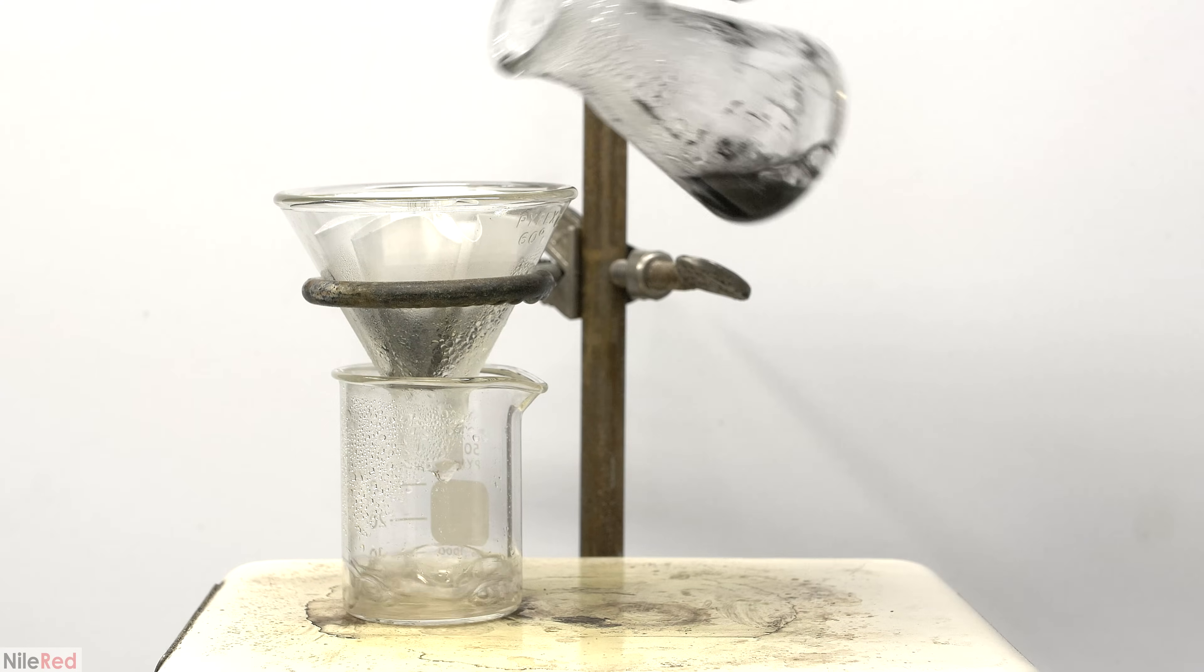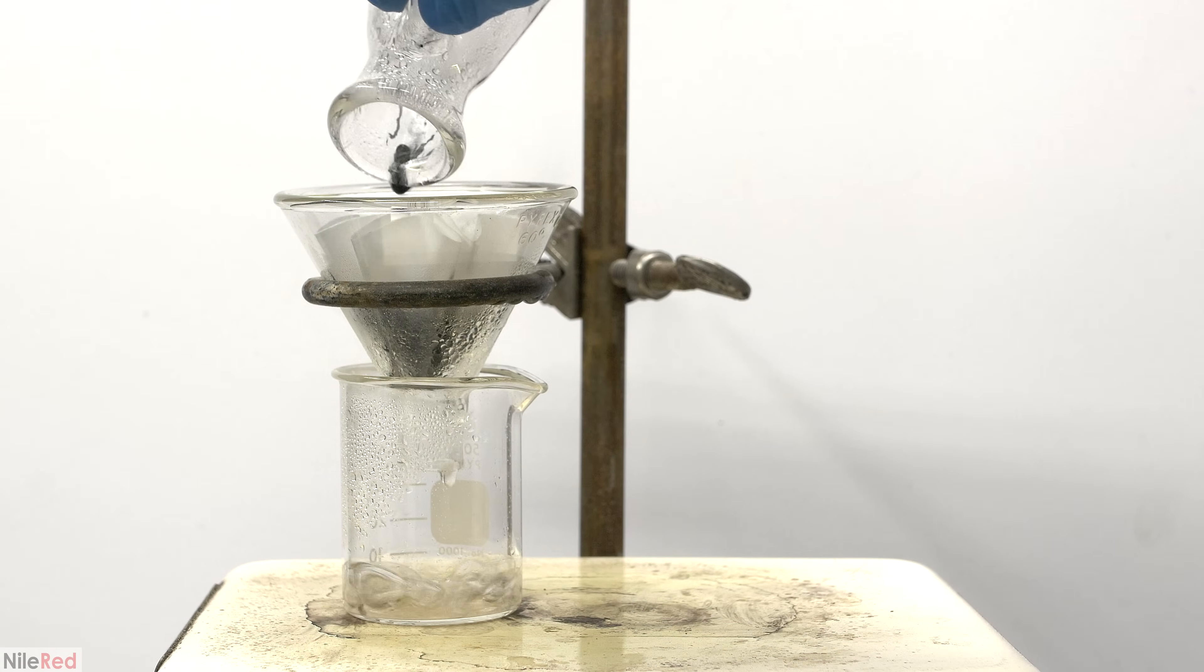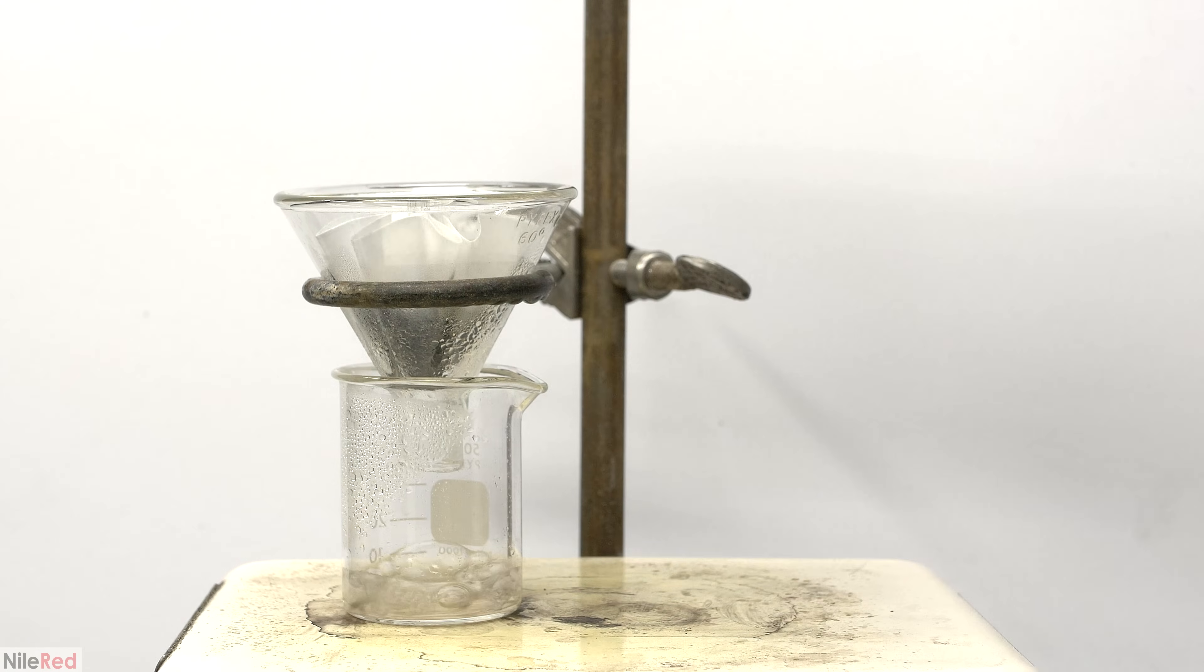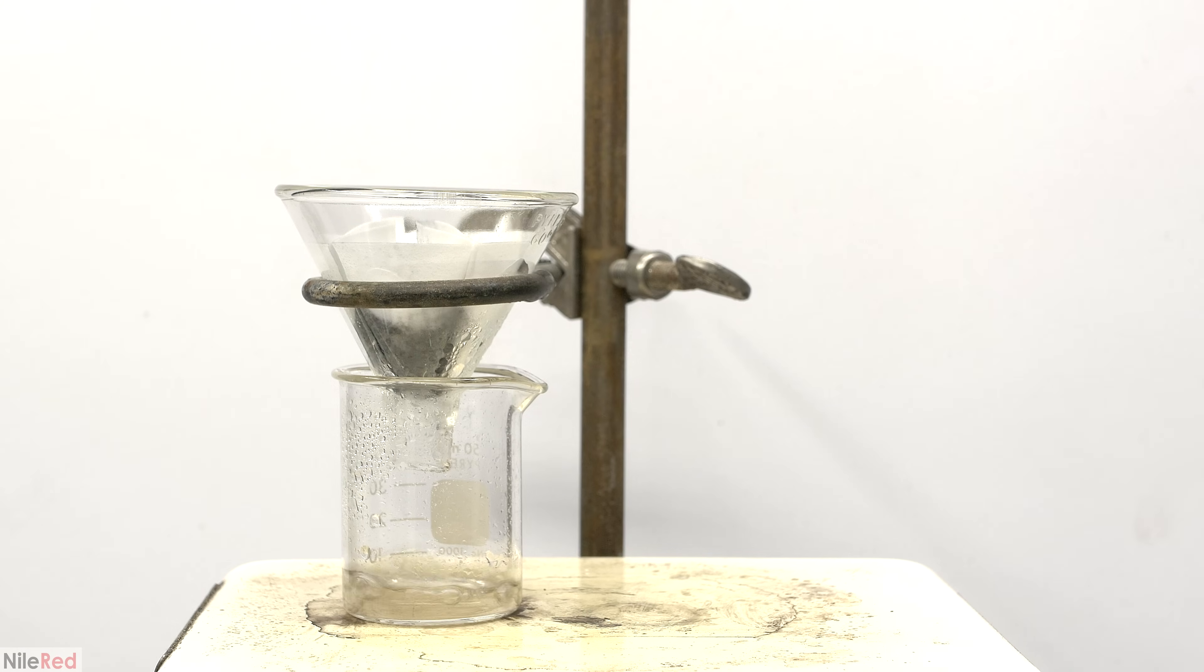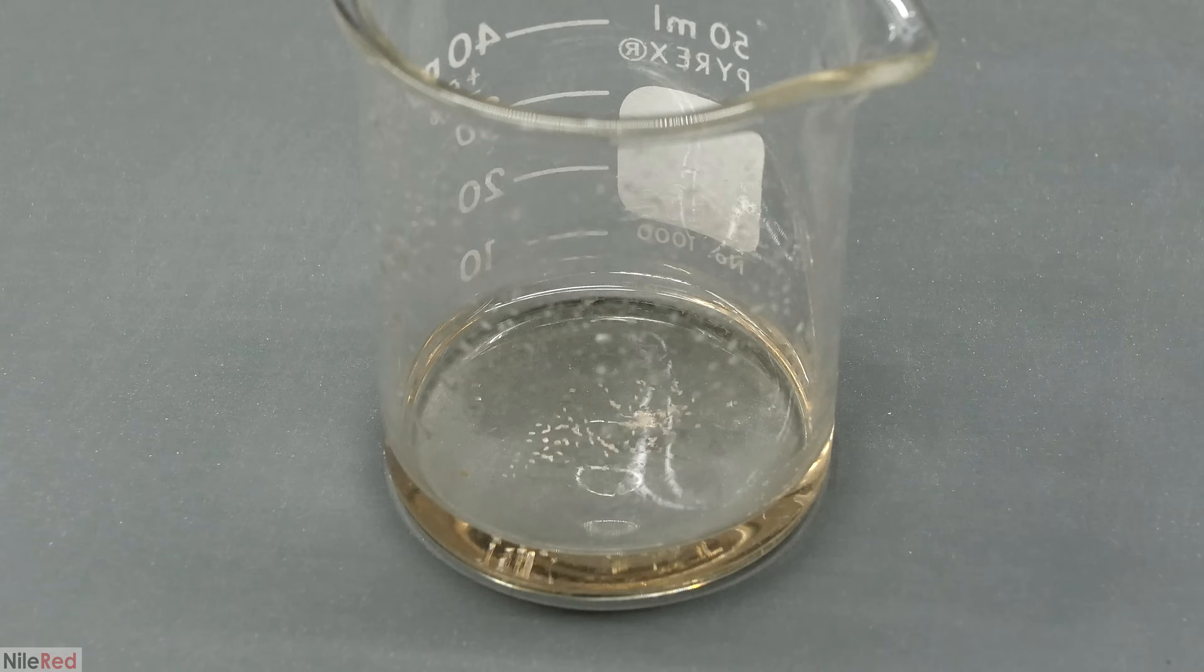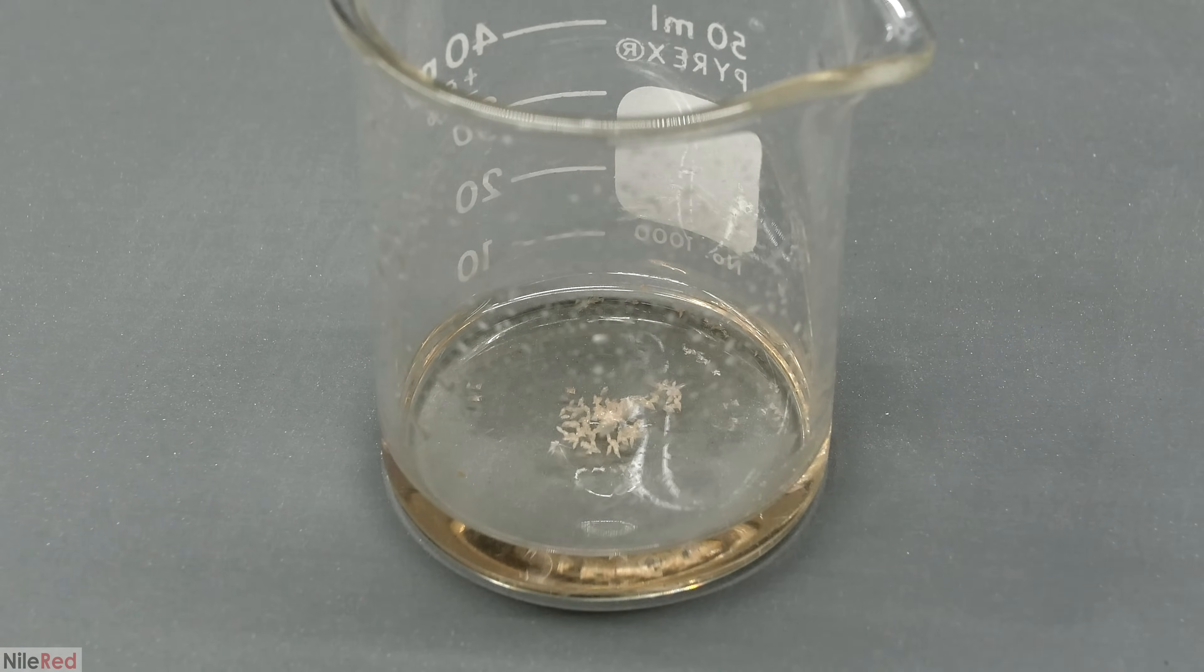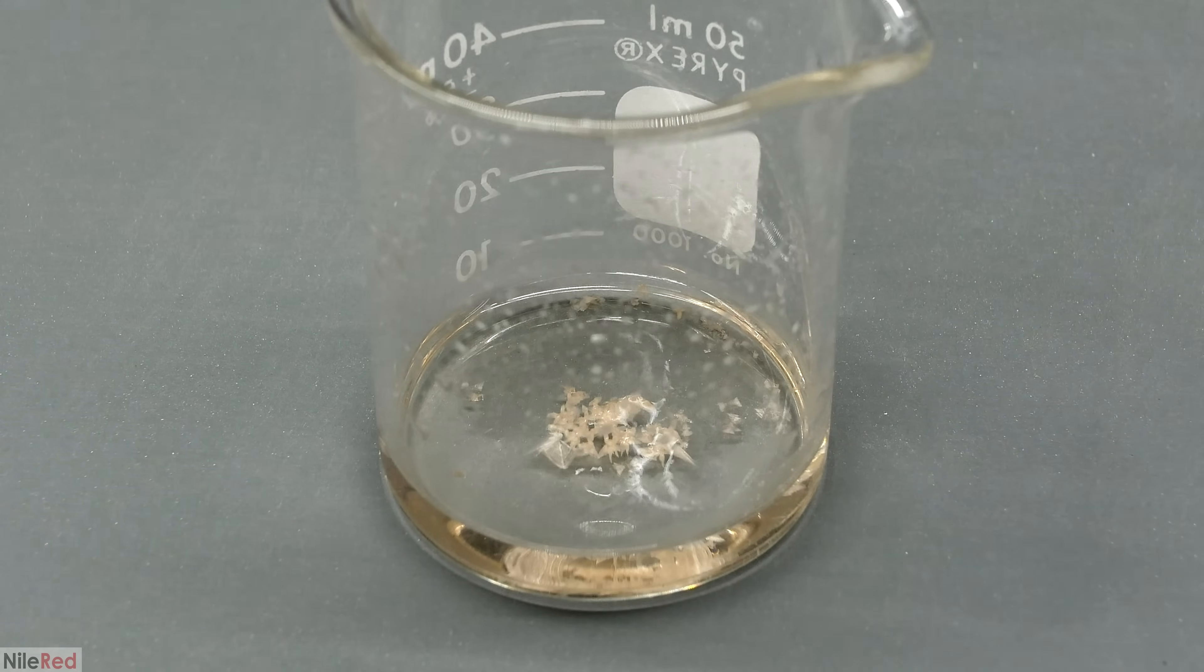Once everything had filtered through, I washed the flask with a little bit of water. I waited for everything to pass through the filter, and then I boiled things down a little bit to get it more concentrated. I did a time lapse, and as it cools, we can see the crystals forming.